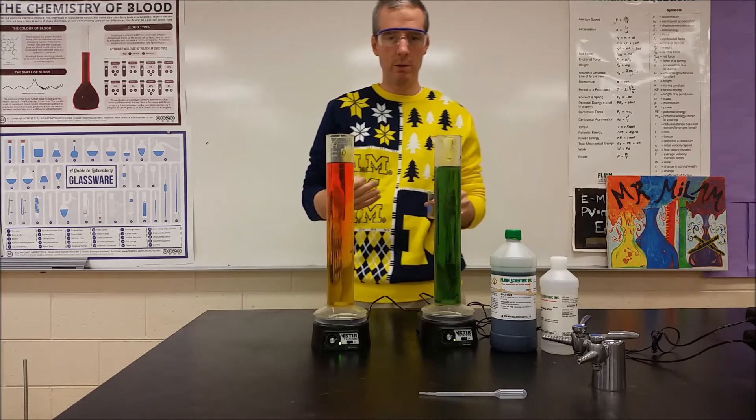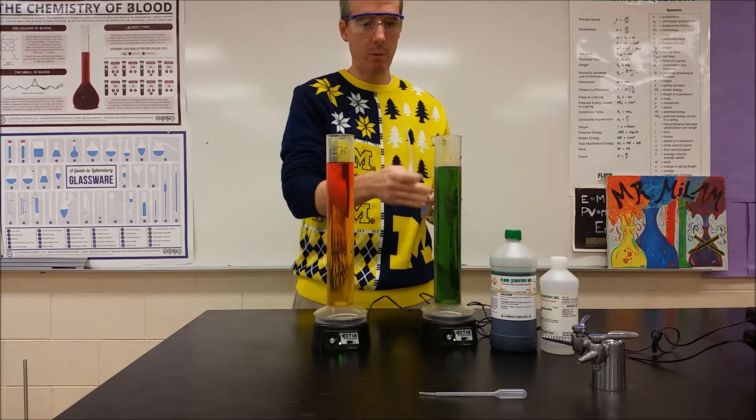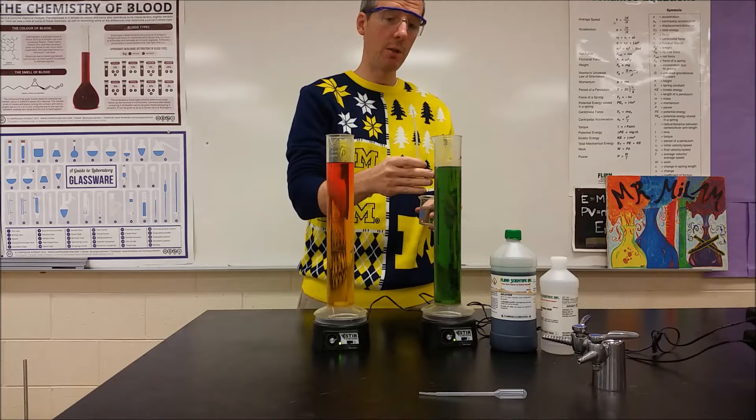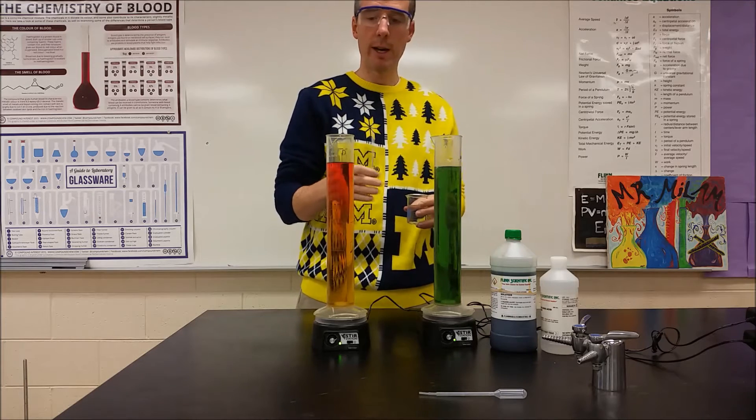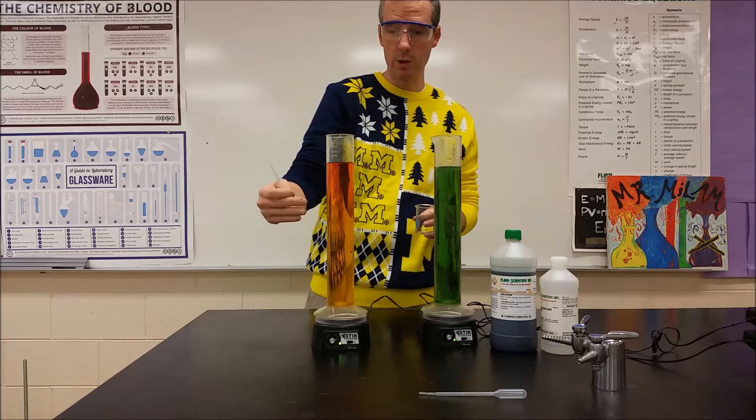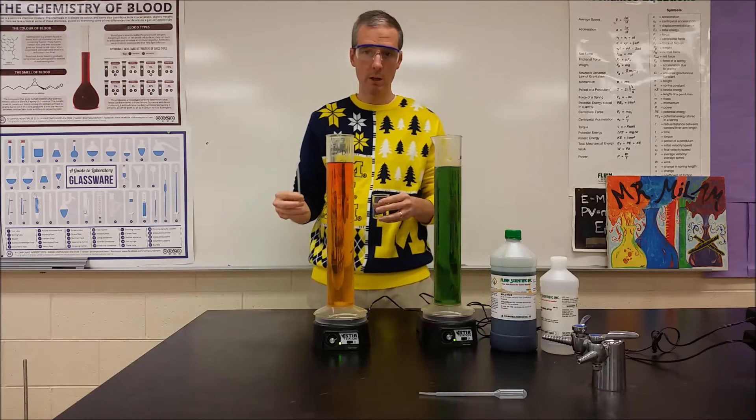So you should know the distinction here that the tap water is much better prepared to buffer or resist the change in pH of the hydrochloric acid as the distilled water is. In fact, this one is really kind of almost permanently changing to orange now from that initial yellow color.